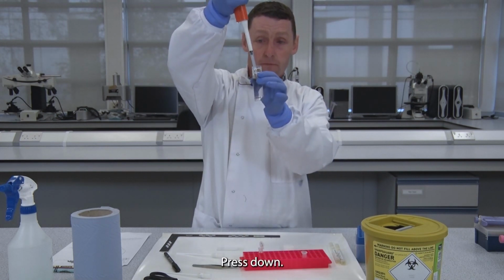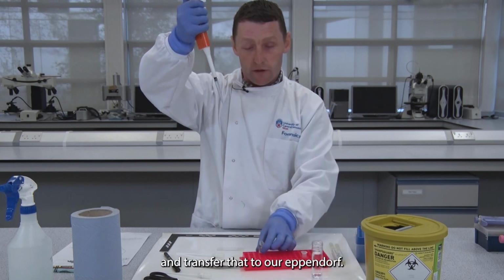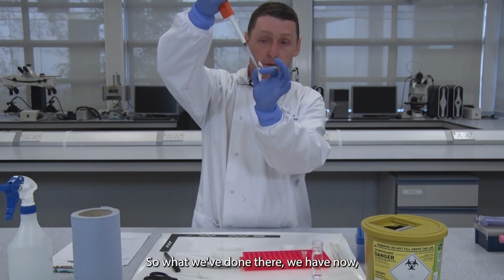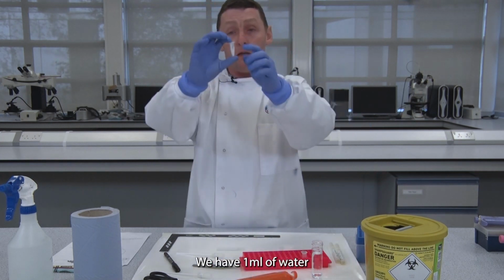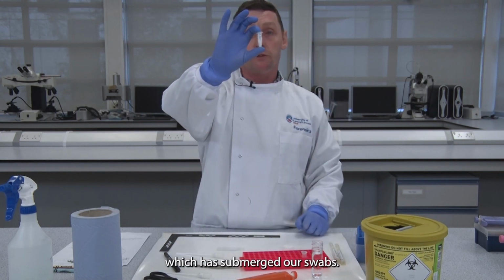Press down, take up your water and transfer that to our Eppendorf. So what we've done there, we have now 1 mil, dispense of your tip safely, we have 1 mil of water which has submerged our swabs.